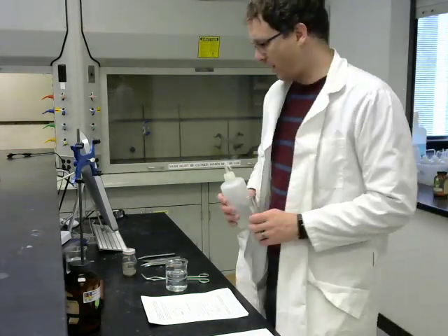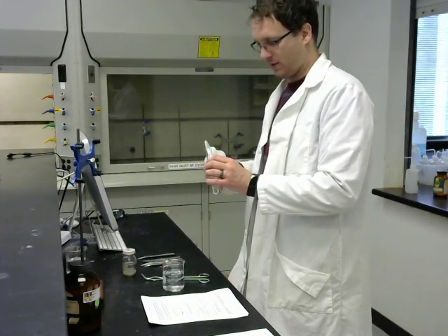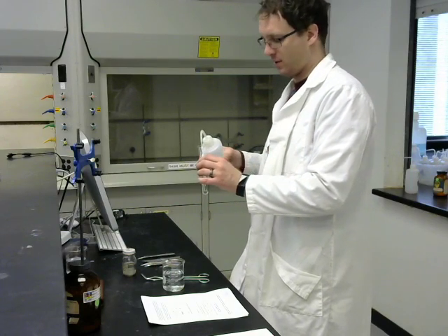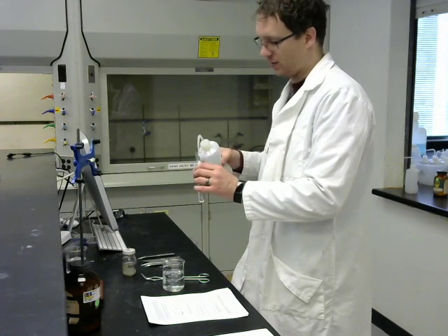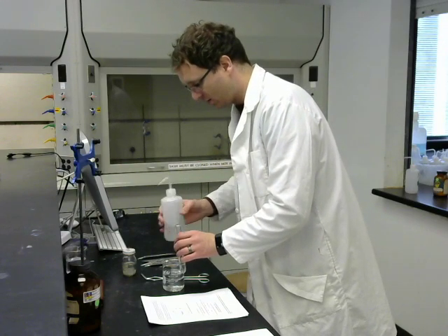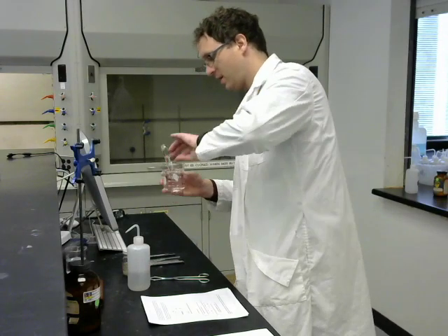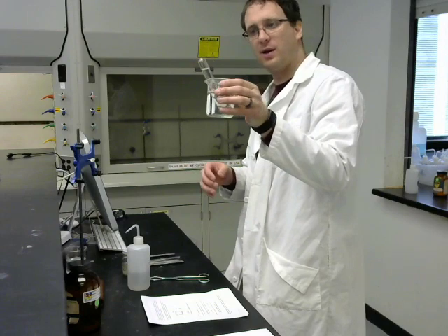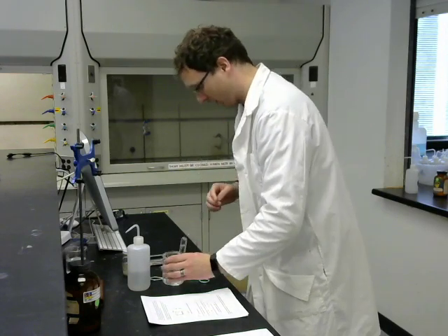I have a beaker here that's filled with just ordinary water, and I'm going to go ahead and fill a test tube with water all the way to the top, and then invert the test tube into the beaker. The idea here is to have as little of a bubble as possible at the top of the test tube. I'm not actually particularly good at this, so it looks like there's a fair amount of air at the top, but I think we'll be all right.